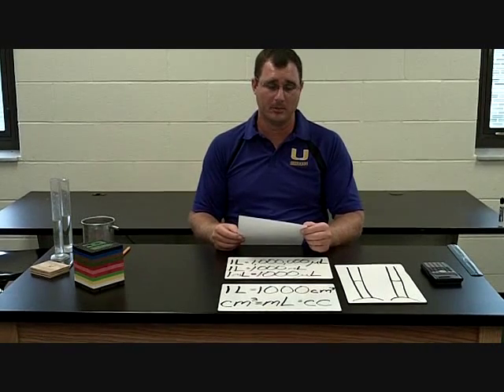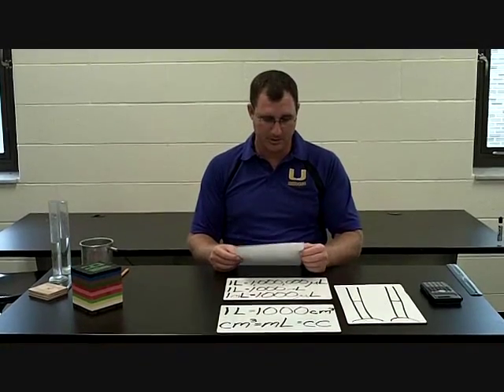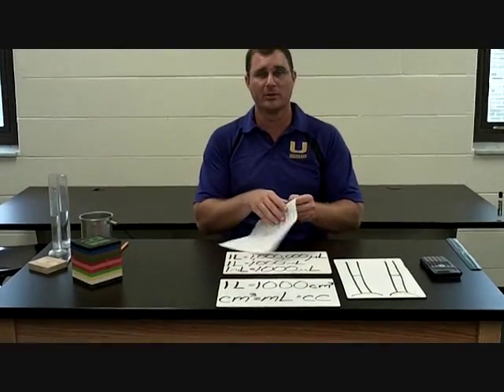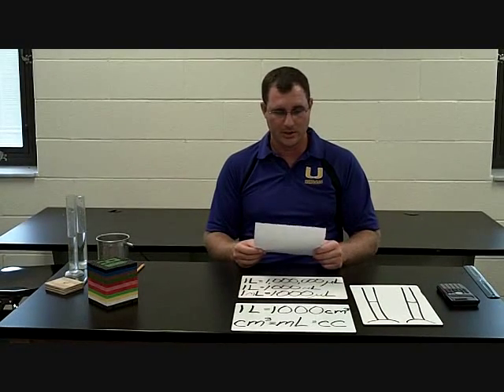Hi, guys. Today we're going to be going over our measuring volume lab, and this is a really good lab. We completed it today here in the classroom, and I'm just going to go over the top part of your sheet with you, and then we're going to talk a little bit about the bottom. And since you're not here, I'll go ahead and do some measurements for you, and hopefully you can use that to complete the second part of the lab, which is the density lab.